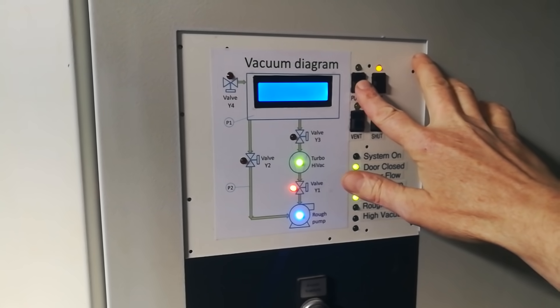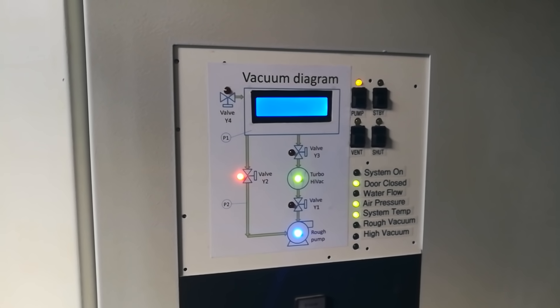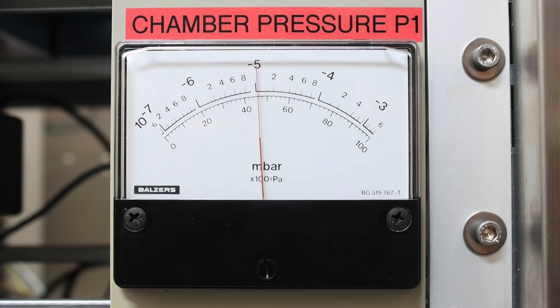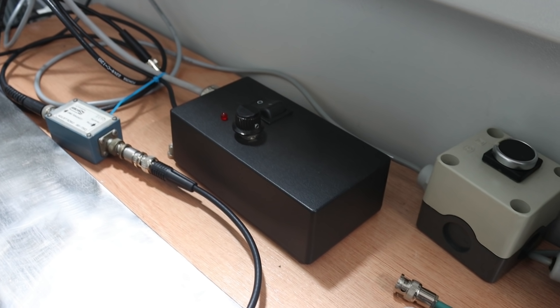Pumping down to the 10e-5 range took about an hour and it mainly takes so long because of the water adhered to the chamber walls.